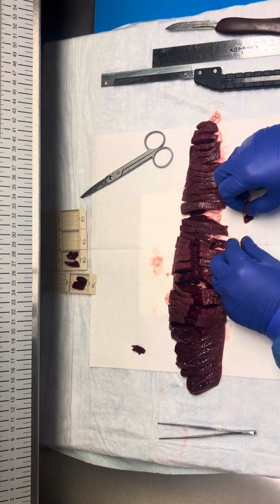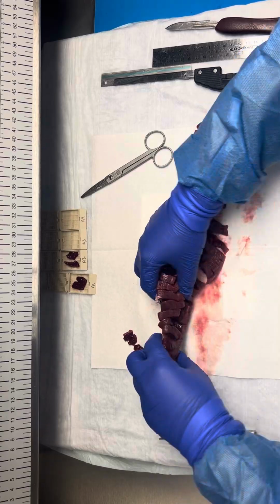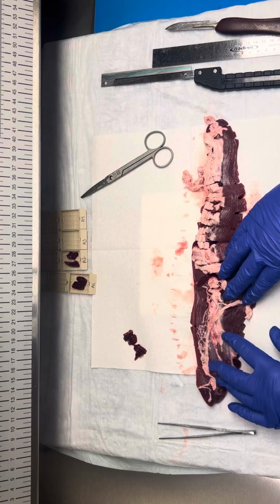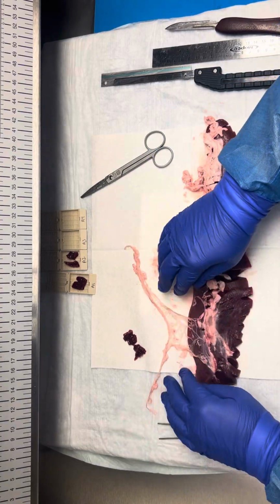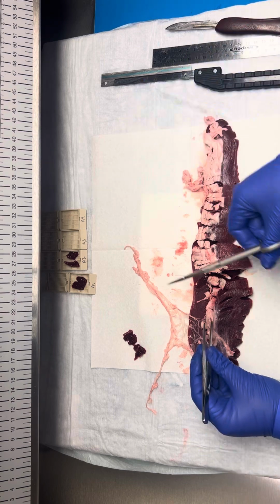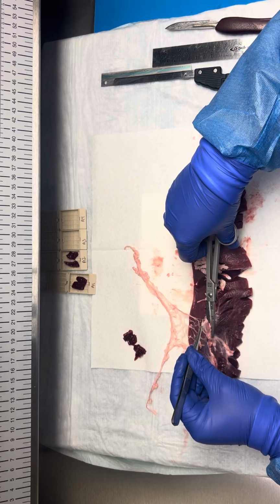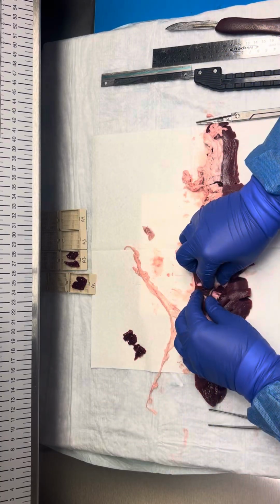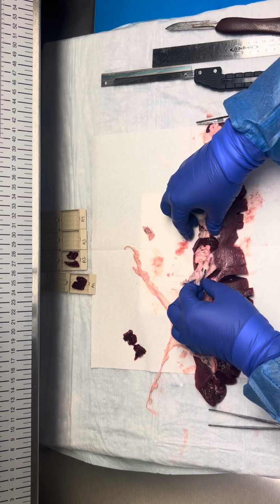So then our last thing that we'll need to do is look at our attached adipose tissue for any lymph nodes. So the spleen, there's usually not going to be too many lymph nodes at the hilum, but in this specimen I can see one right away. I have one right here. And then you can just kind of palpate through and see if there's anything else.